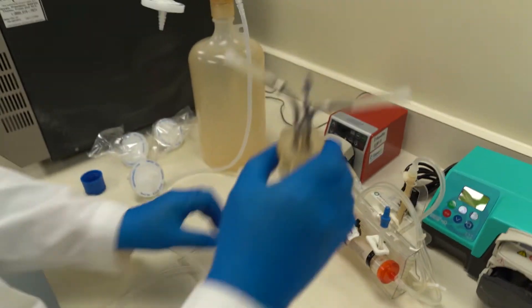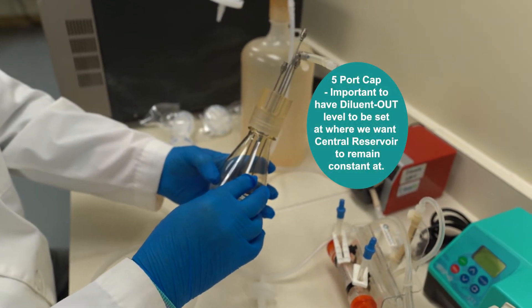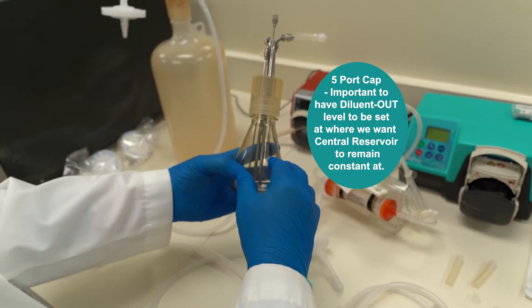And here's our five port cap. And then it's important to have the diluent out level to be set at where we want the central reservoir to remain constant at.